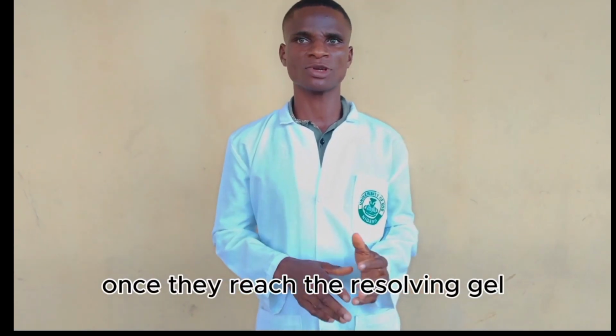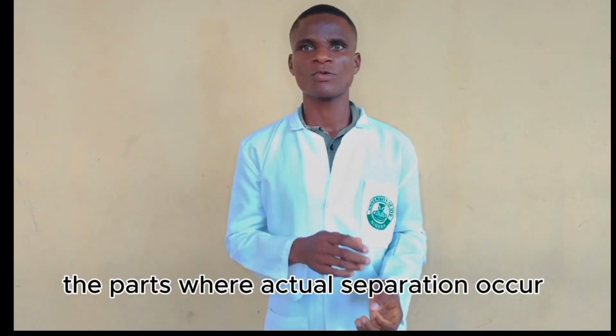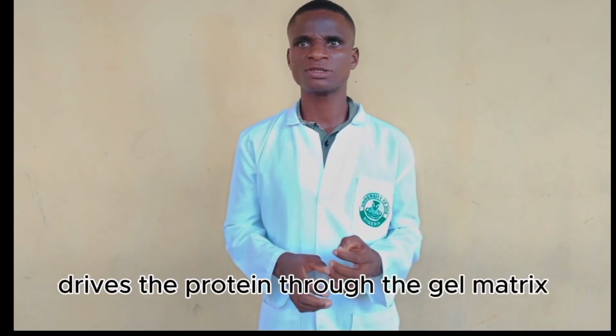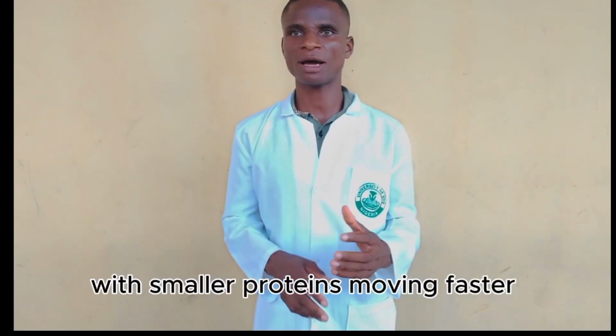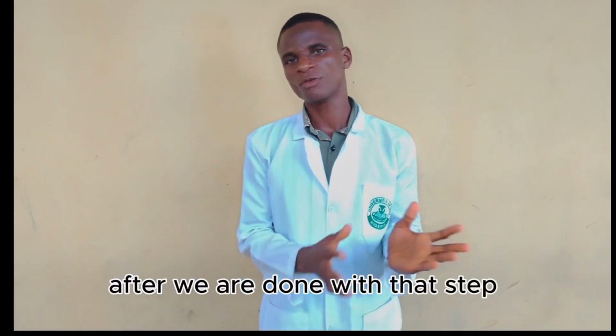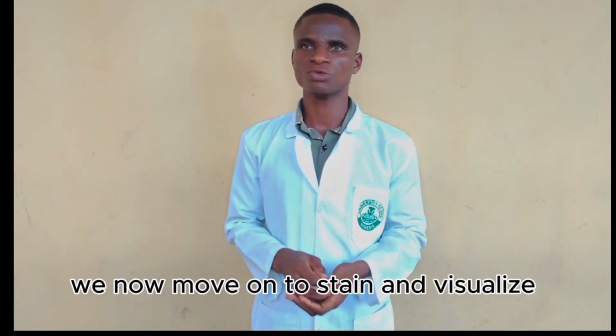Once they reach the resolving gel, the part where actual separation occurs, we increase the voltage to between 120 and 180 volts. Voltage drives the proteins through the gel matrix based on their size, with smaller proteins moving faster and farther than the larger ones.